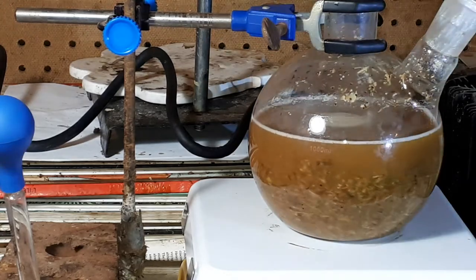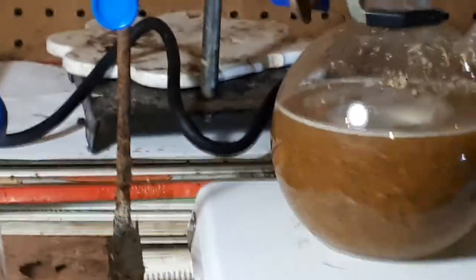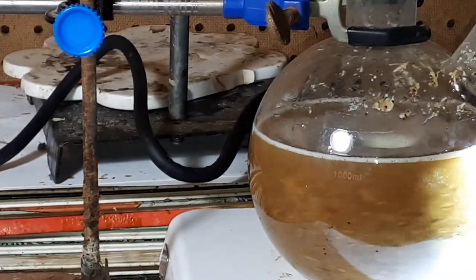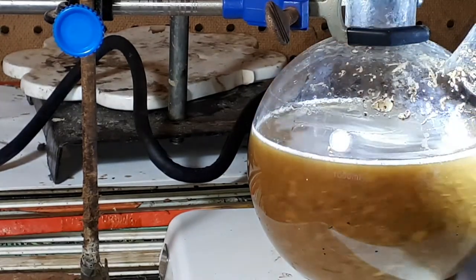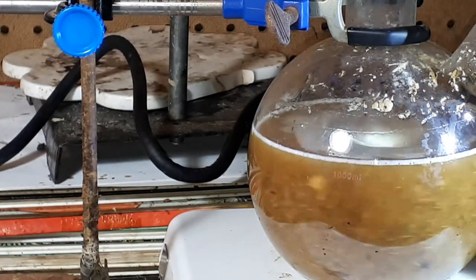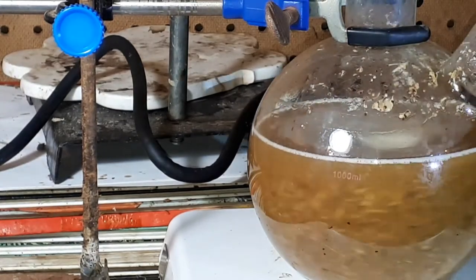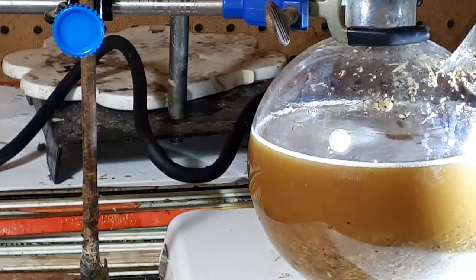If you look into it and zoom in closely, you can see that these sub-particles are basically absorbing the ketones and the aldehydes and different organic materials that give the licorice smell. I don't know exactly what causes that, but there are oils — I assume the oils are at 2 to 3 percent, though I'm not sure if the oils create the aroma itself.